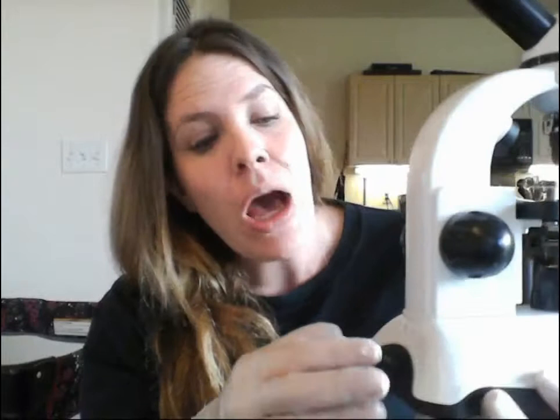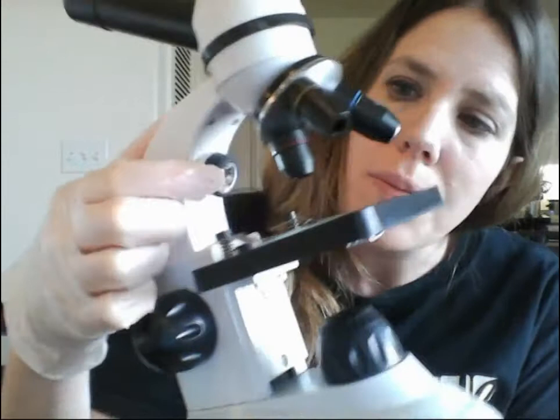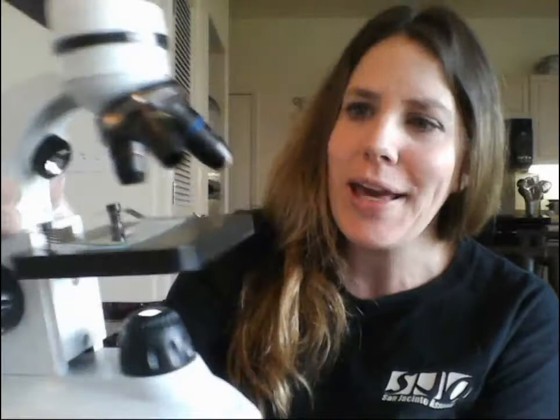This is actually both a dissecting and a compound scope. For this lab we're using it as a compound scope, meaning you get magnification from the ocular and objectives compounding on each other. For a dissecting scope, you'd turn it toward the two lines to the right, bringing light from the top for looking at big objects like whole insects. But we're using it as a compound scope, so we want the light from the bottom — turn it to the left.